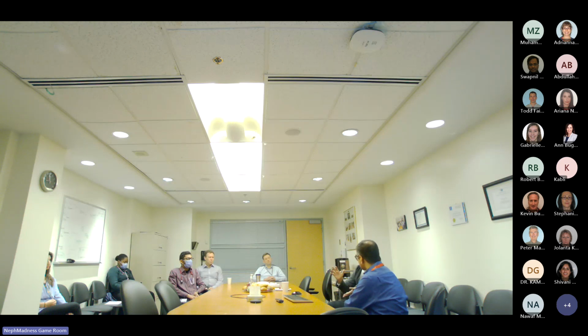Once you have a good microscope, you can use an iPhone and get high quality images, and spend a good amount of time. Yes. All of us have taken board examinations where we get an image of a cast and they ask us, what is this? And the quality and the resolution is not optimal. So it makes a big difference.